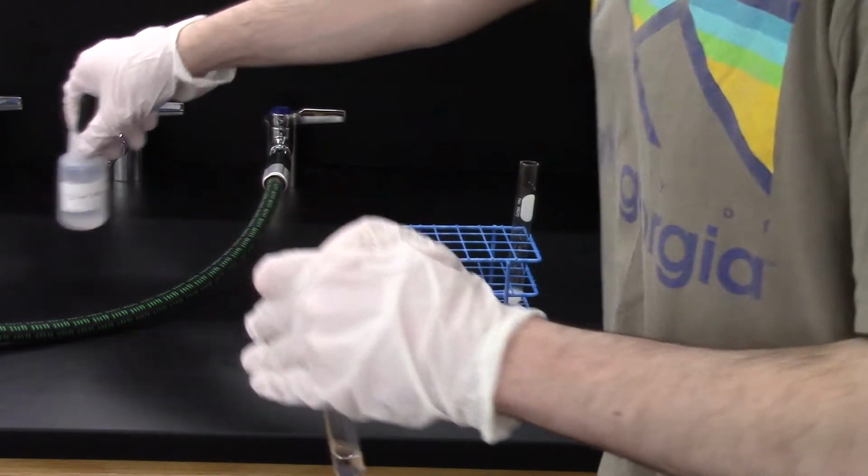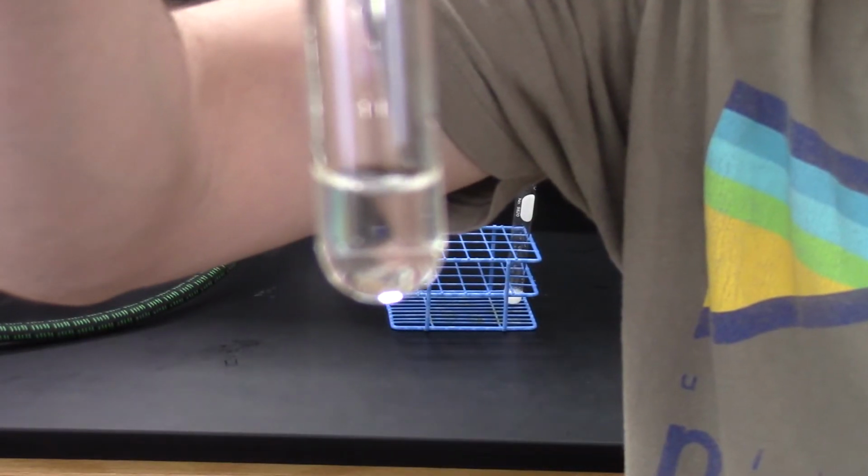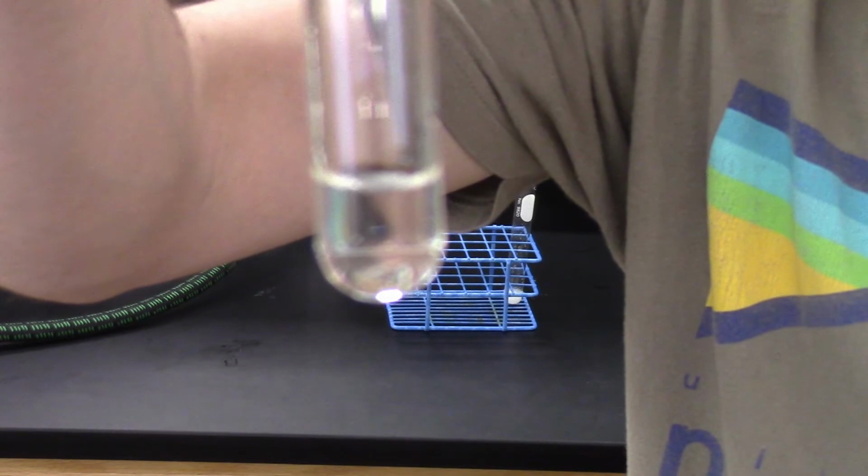Did a reaction take place here? Think about what kind of reaction can happen if you combine two aqueous ionic compounds, and whether that's possible with these two substances.